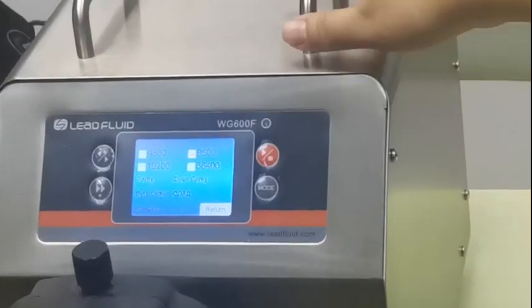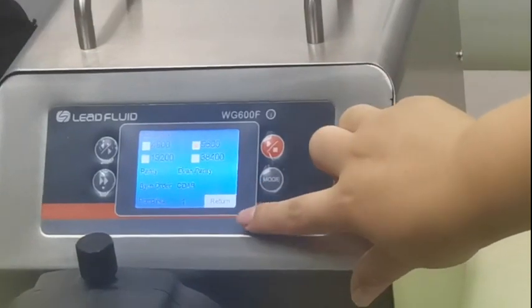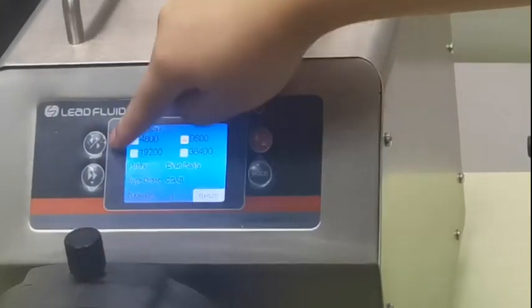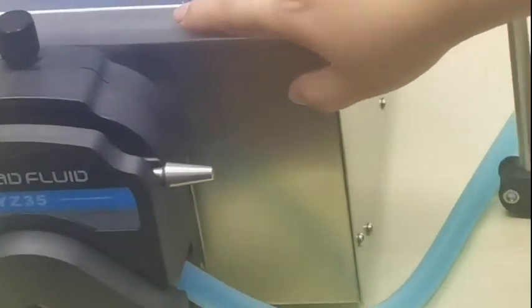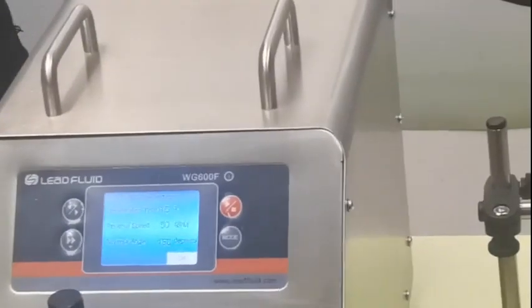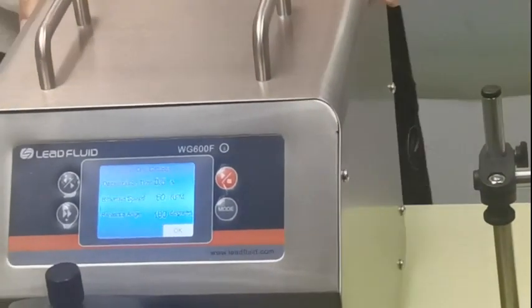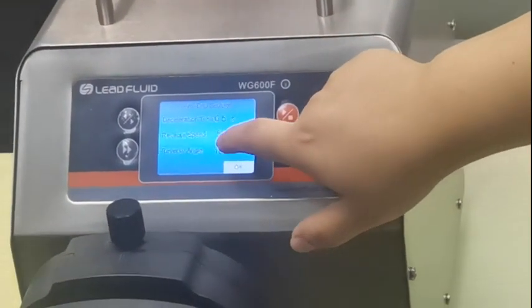This is the communication port setting — when you use a computer to control the pump, you need to choose this function. There is also an anti-drop setting: if there is liquid leaking or dripping, you can use this function.